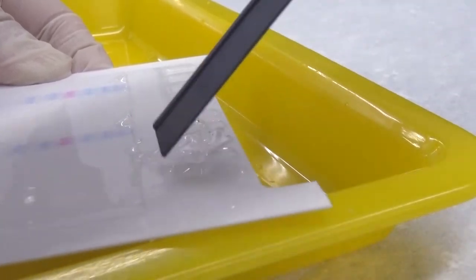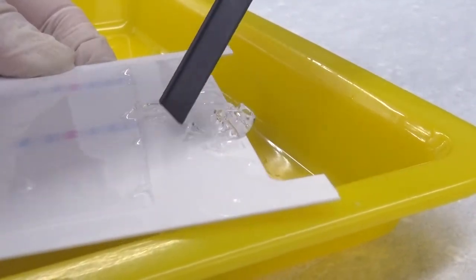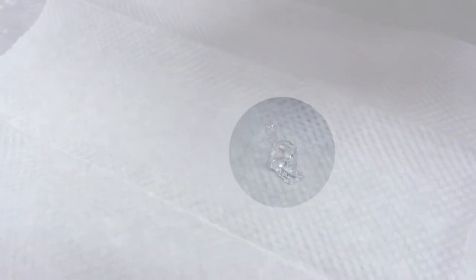Push the separated upper gel away and onto a piece of paper towel for disposal. This way, the discarded gel will not stick to other objects.